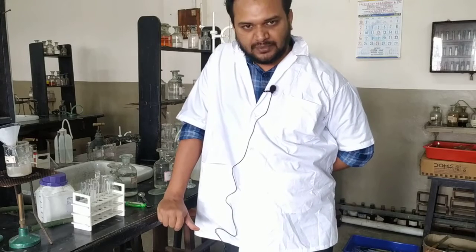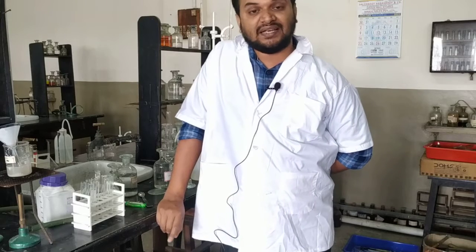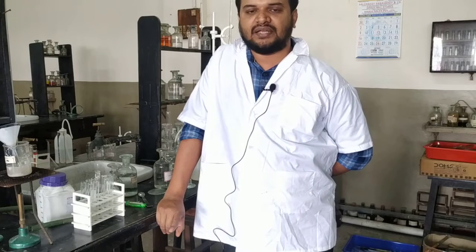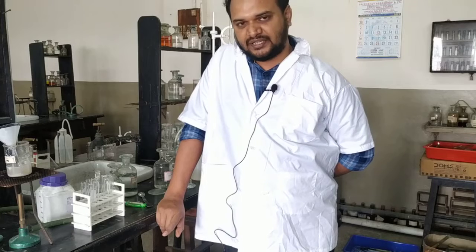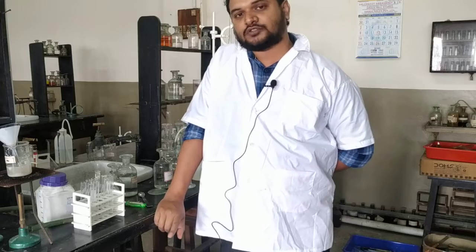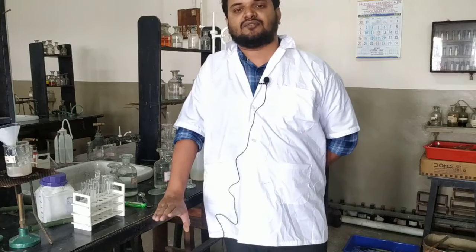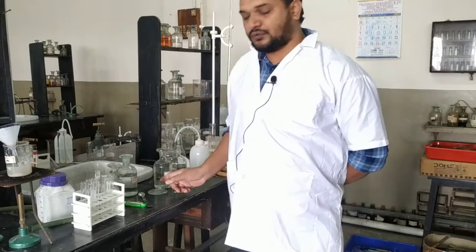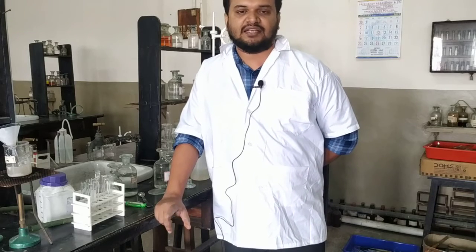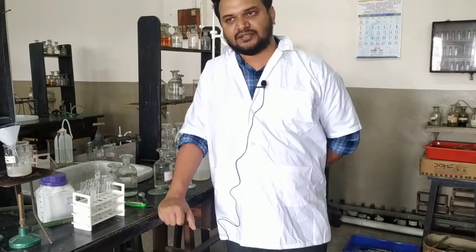Then you prepare the sodium carbonate extract, take the filtrate, and neutralize it with either dilute HCl or dilute HNO3 since you are doing the test for sulphate. After neutralization, add barium chloride. A thick heavy white precipitate is obtained. Again, it may be sulphate. Now that precipitate is not soluble in excess dilute HCl or excess dilute HNO3, so sulphate is confirmed. So the white salt which was given to us contains Zn2+ as the cation and SO4 2- as the anion. So the salt is zinc sulphate. Here your practical is complete.